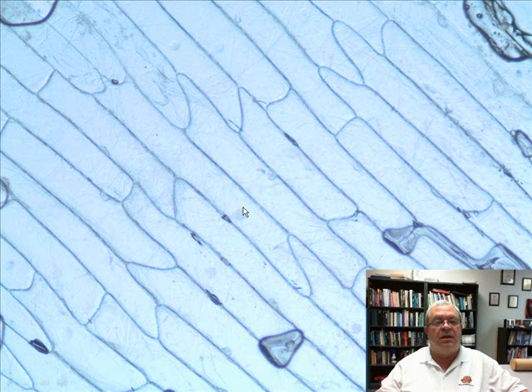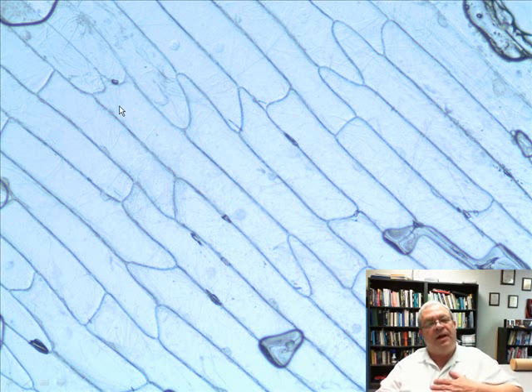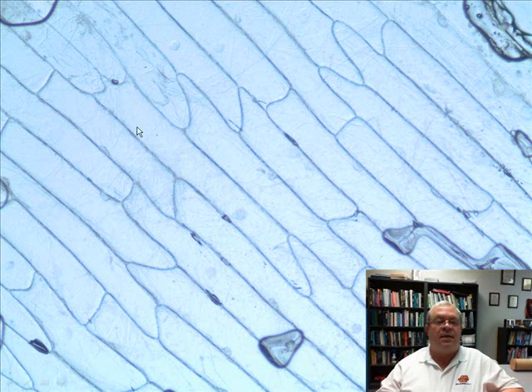And then finally, well, I'm not sure it's finally or not. What is just inside the cell wall of all these cells, pressed against the cell wall? Something called the plasma membrane. Absolutely, the plasma membrane. Now finally, I think, this region in here between the plasma membrane and the nucleus, what's the general term for that? That's called the cytoplasm. That's right, the cytoplasm. The area between everything, in the region between the plasma membrane and the nucleus.